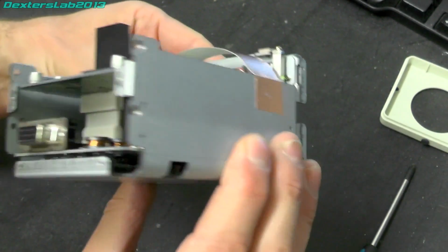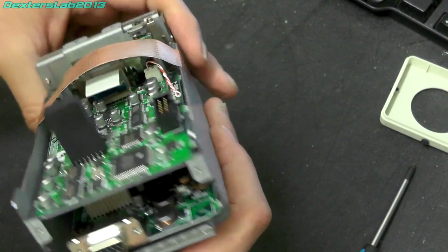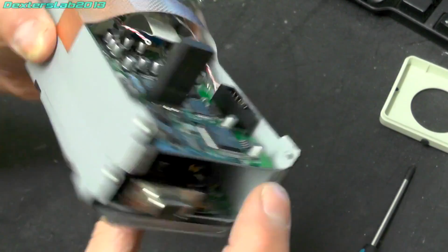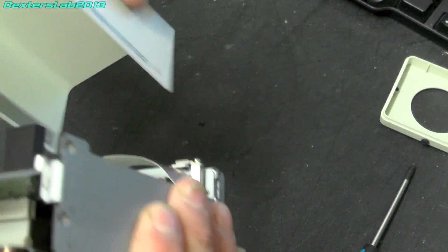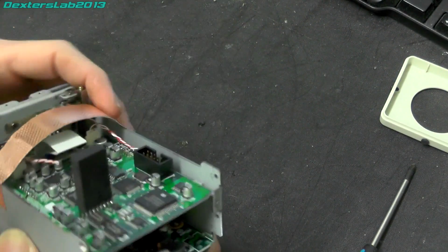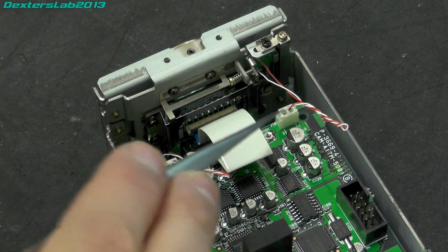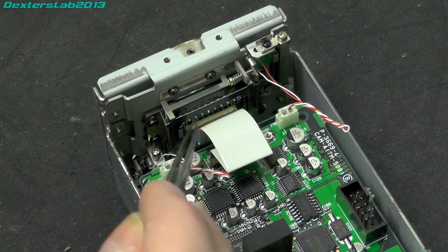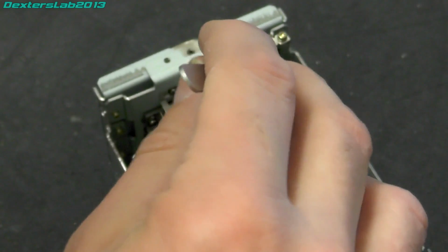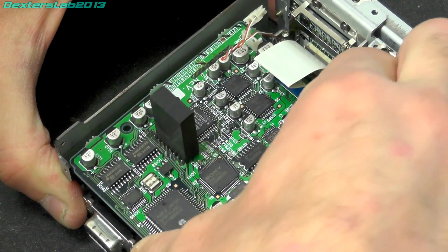See a bit more in there. Looks like that board isn't actually mounted on anything other than the connectors. Interesting. But we do have this big rubbery thing, which presumably made contact. Yeah, so that would have prevented it coming off anyway. So if we look here, we've got these two connectors just here that come from this top board down onto a couple of actuators, which are attached to the structure that the CCD is on. So there's two of those, one down there and one up at the top. So I'm just going to take the top board off, slowly wiggle, wiggle out.